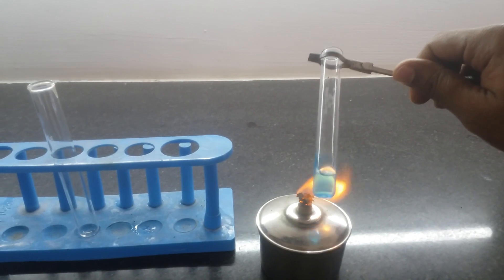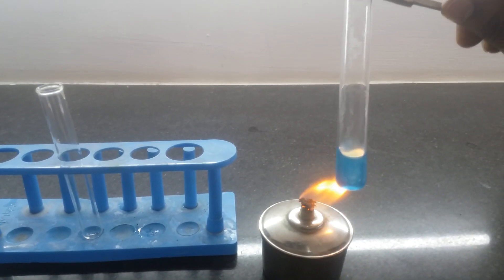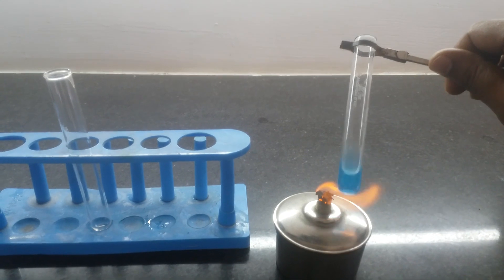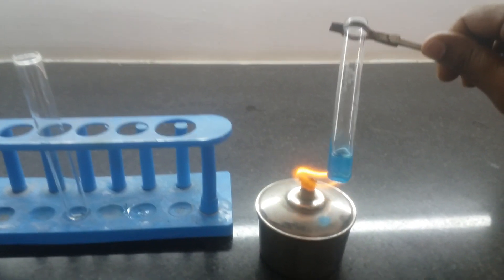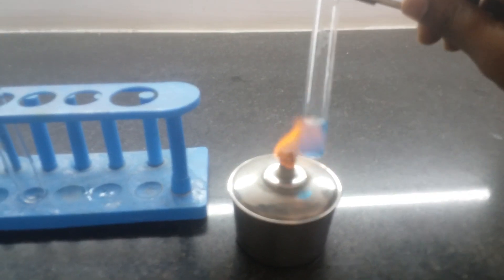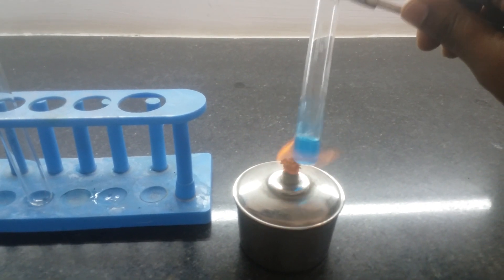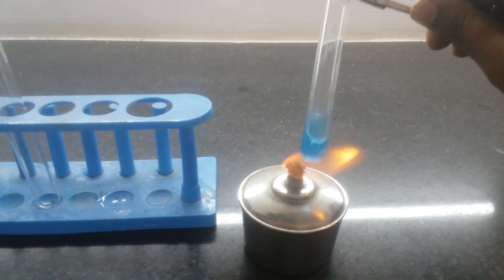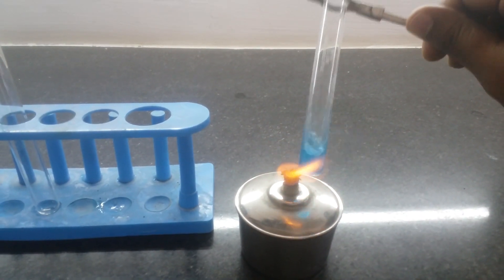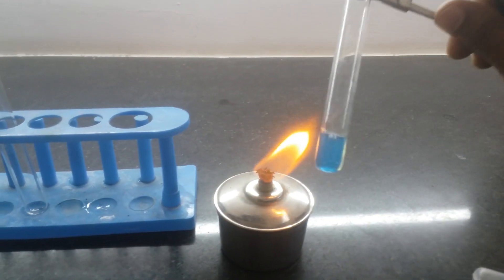Simultaneously, you should notice the change in color. If there is a presence of glucose, this color will change slowly into green, then yellow, then orange, and finally to a brick red color.